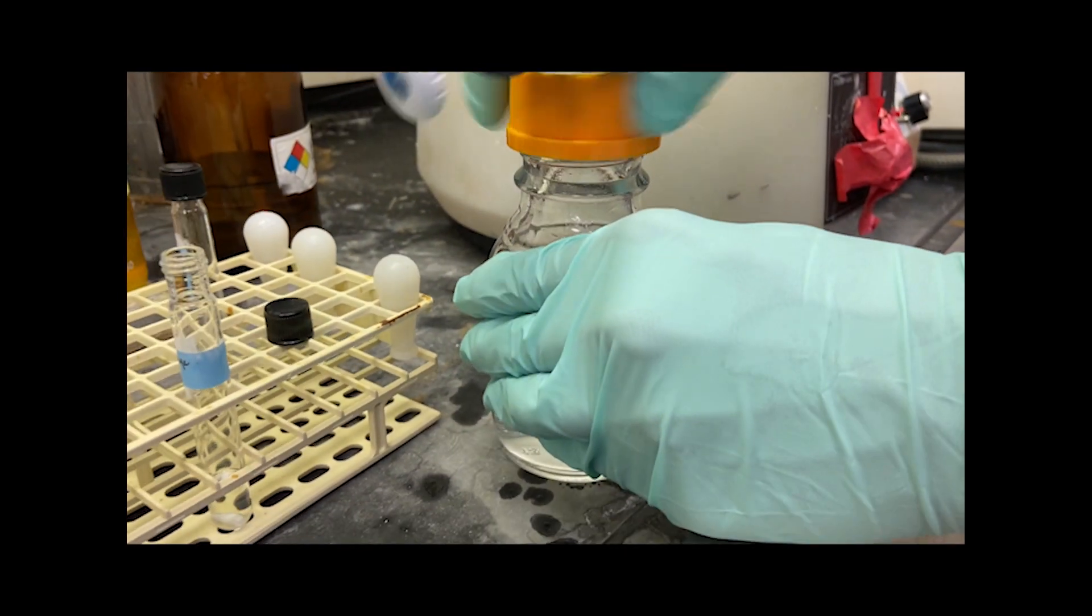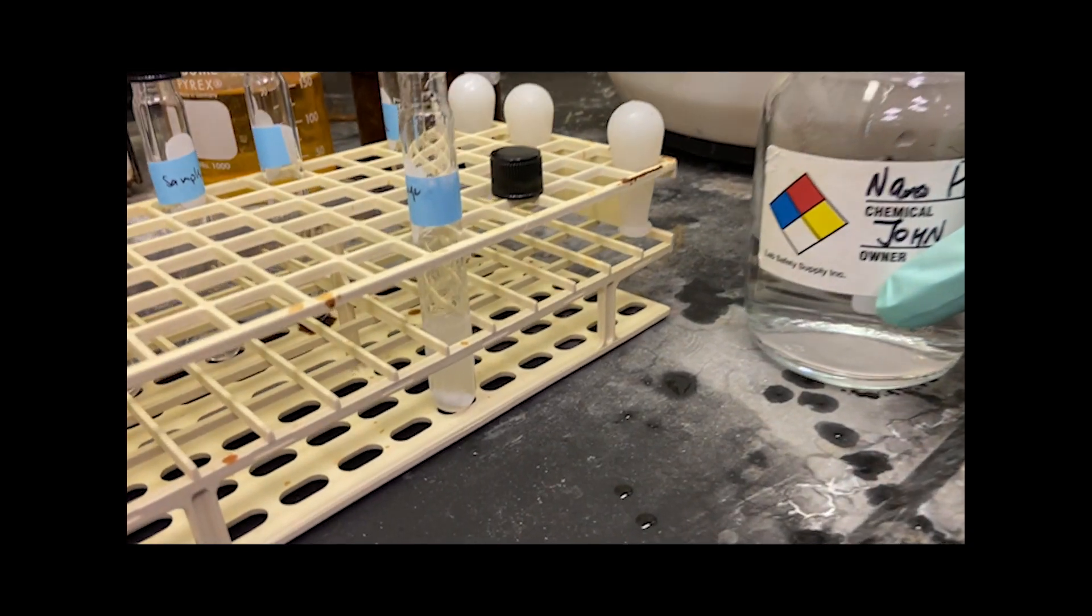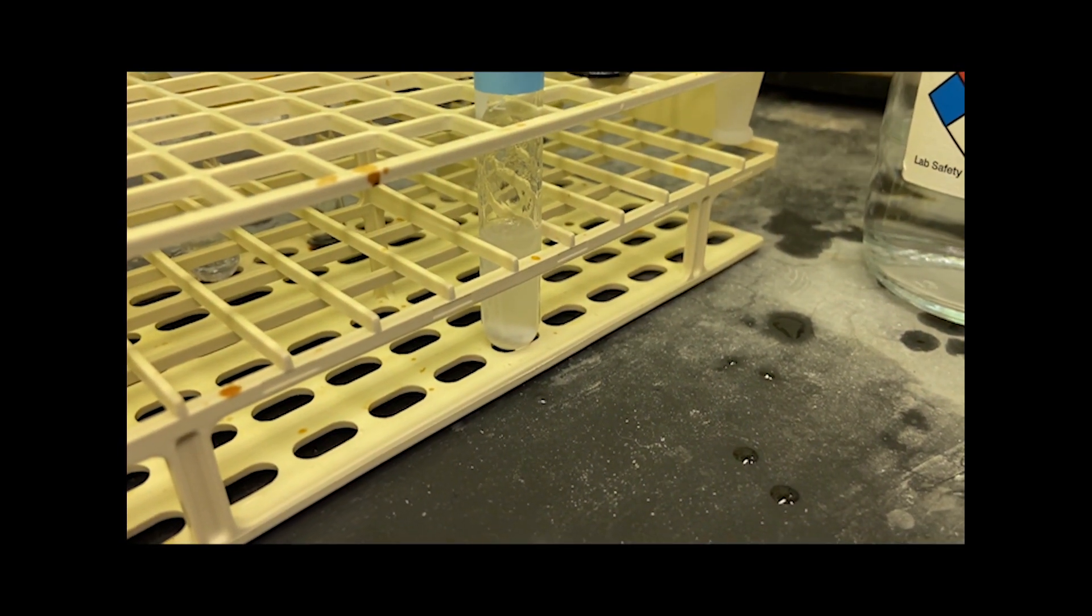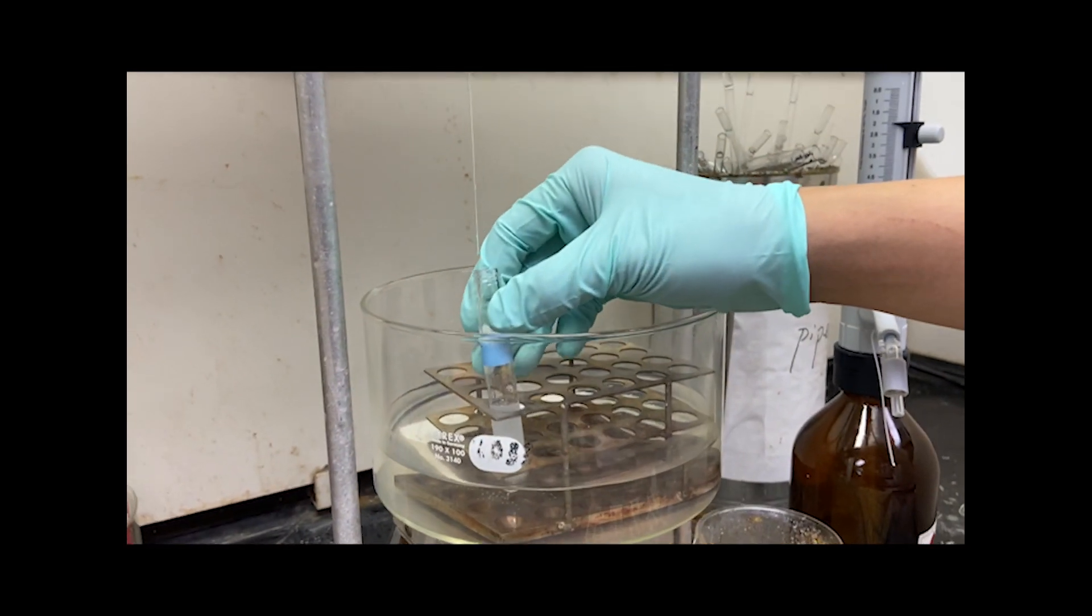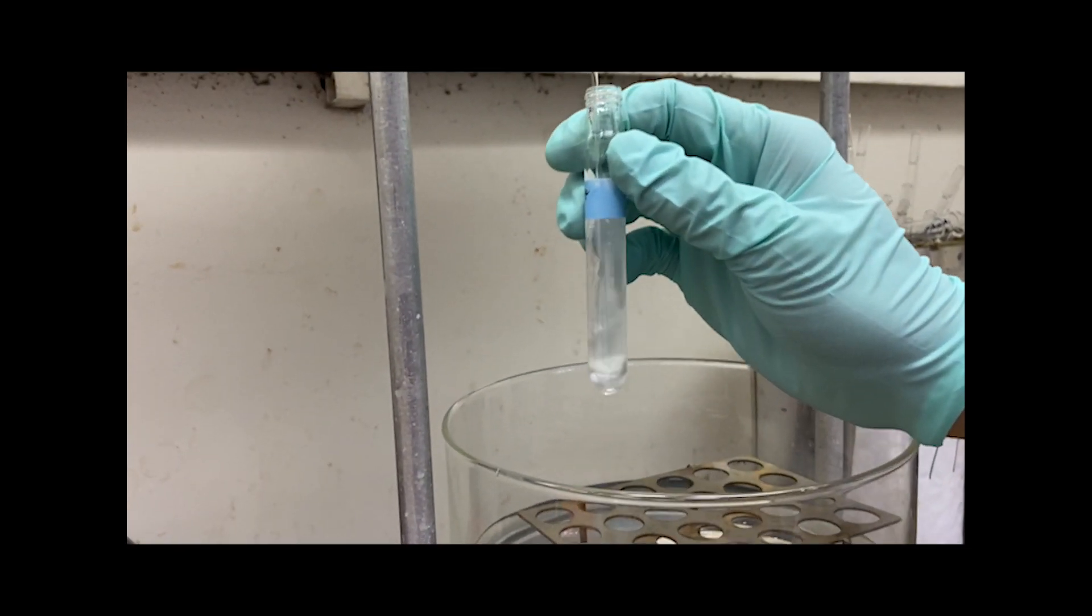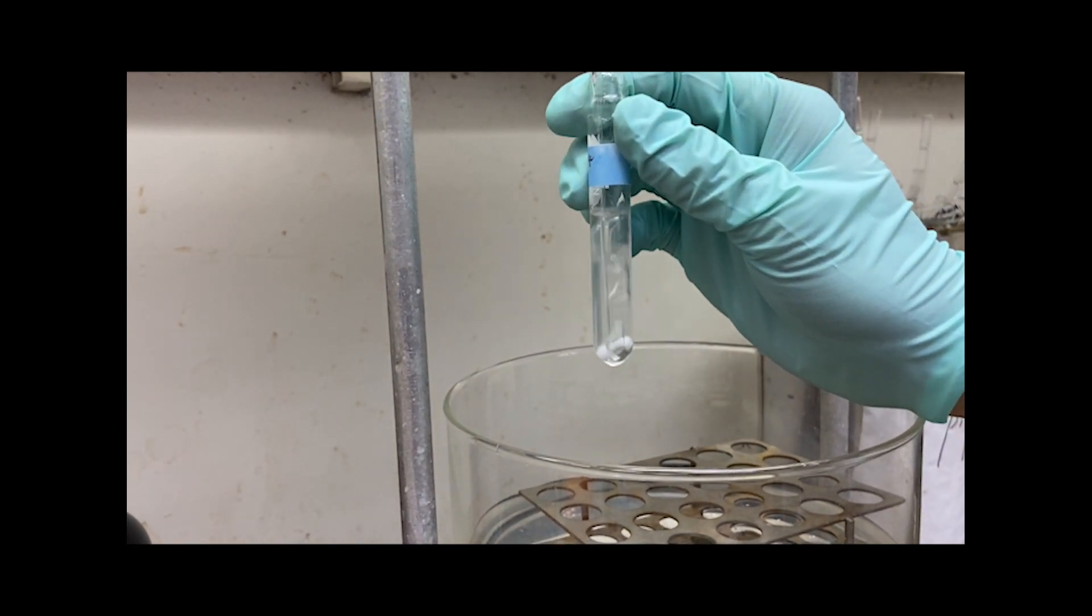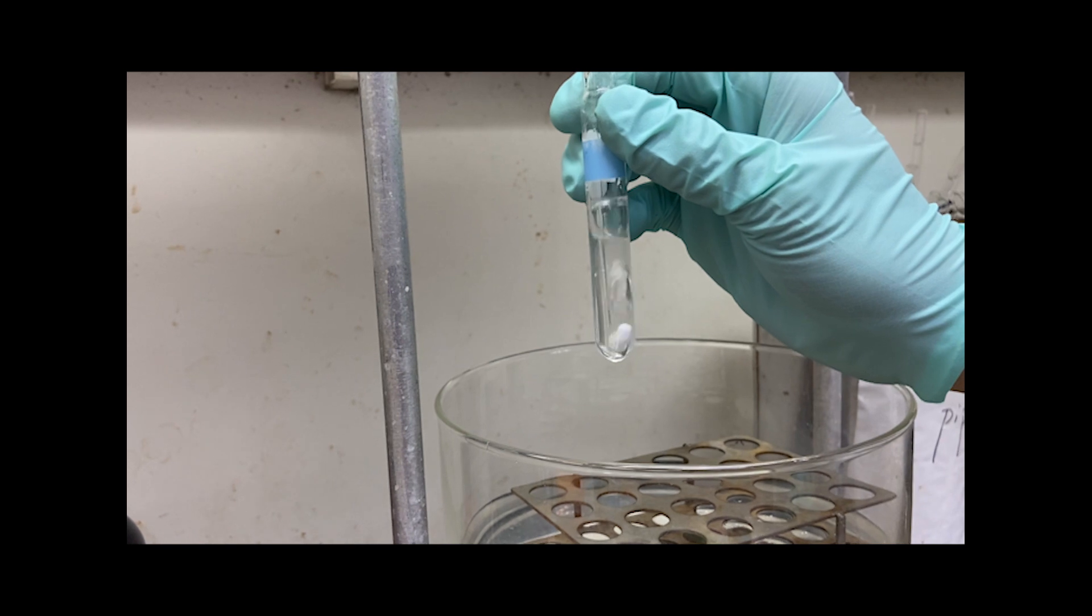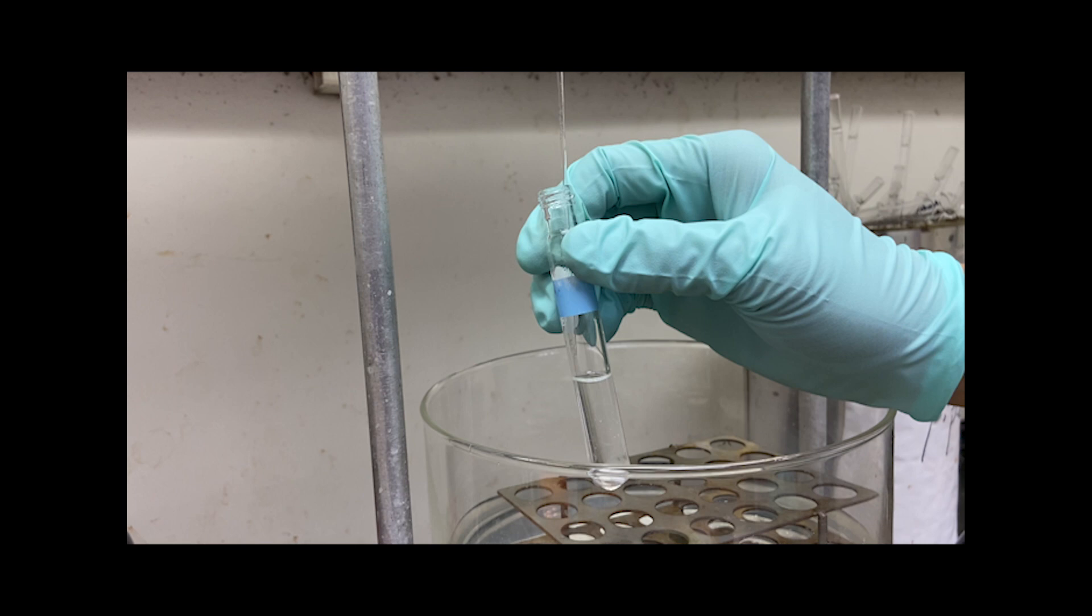Now, to neutralize the iodomethane, we add 2 milliliters of water, which will turn the sample cloudy. And to remove the iodomethane, we evaporate it out by streaming nitrogen gas through the sample using our blowers by placing the pipette at the bottom of the tube. The iodomethane has completely evaporated off, and the sample turns back to a clear solution, which should take about 20 seconds. The sample may not become clear if something else is in the solution, in which it is okay to continue.